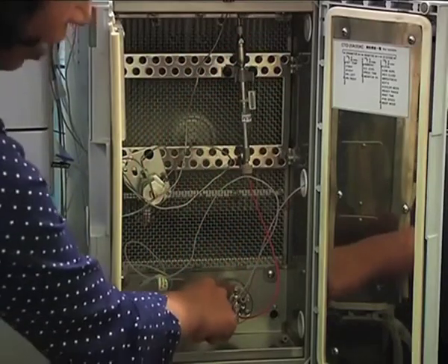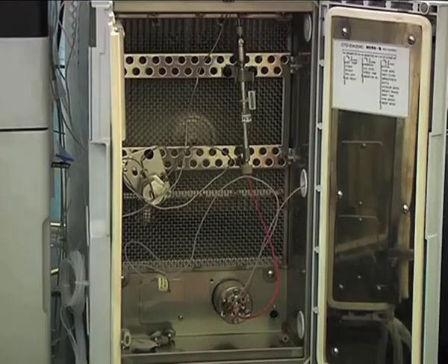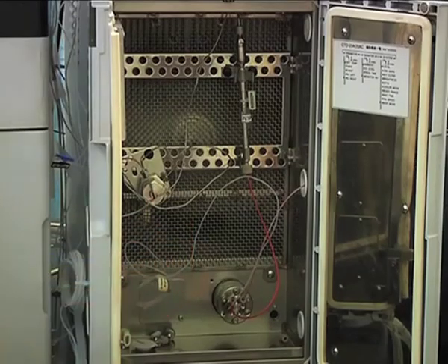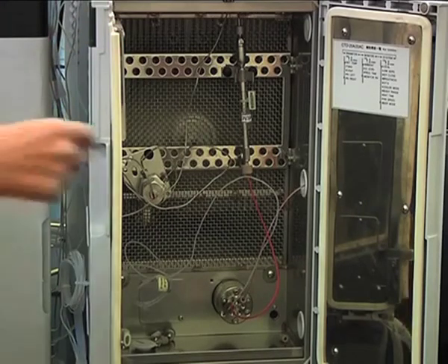This part is called the flow control valve, FCV. What is the use of this part? If you want to minimize the contamination of the MS, you can use FCV. For example, I know that up to 10 minutes, all my peptide peaks are coming out of the column, and from 10 minutes to the remaining 5 or 10 minutes, whatever is coming is unwanted material from the tissue lysate, which I don't want to send to the mass spec because it might contaminate it. So I can give commands.